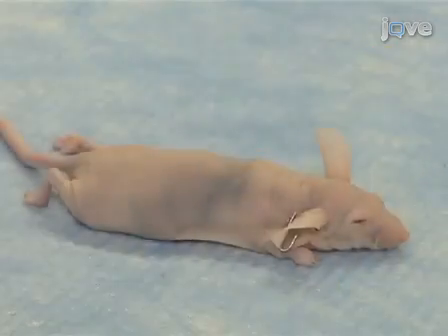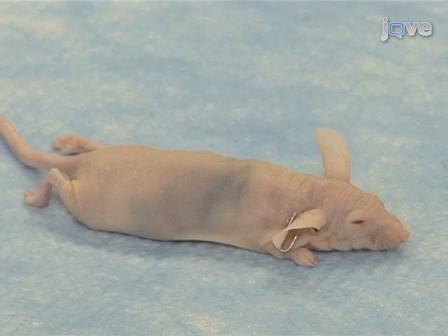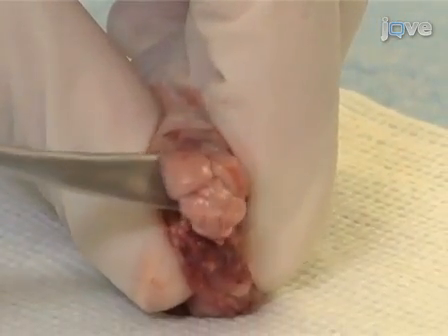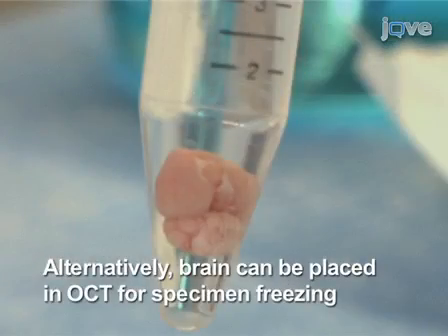Euthanasia of the animal should be performed if the animal displays a significant decline in health, especially if there is weight loss of greater than 20% of the maximal weight. Quickly excise the mouse brain from the euthanized mouse. Then, place the brain in formalin for subsequent analysis of tumor morphology and immunohistochemistry.